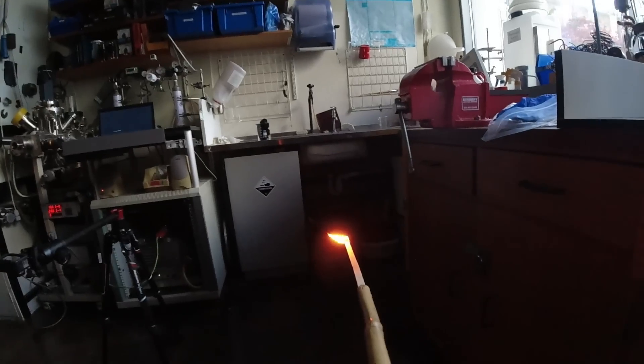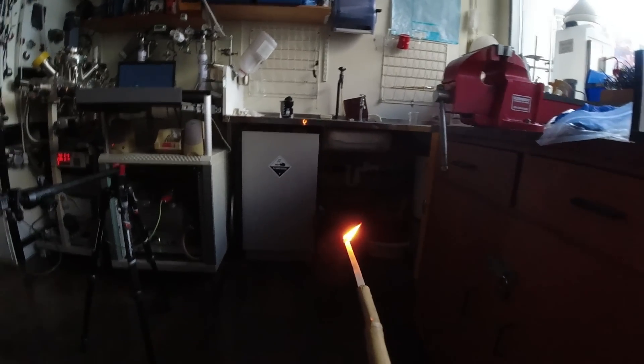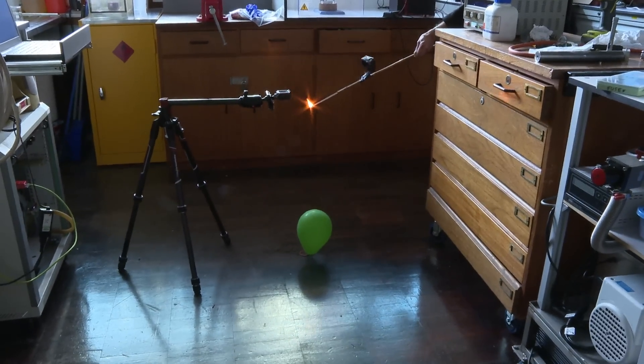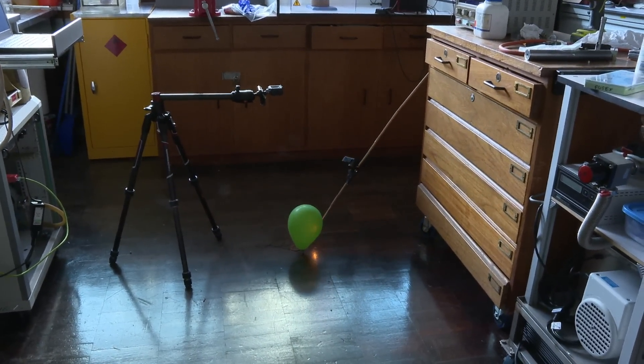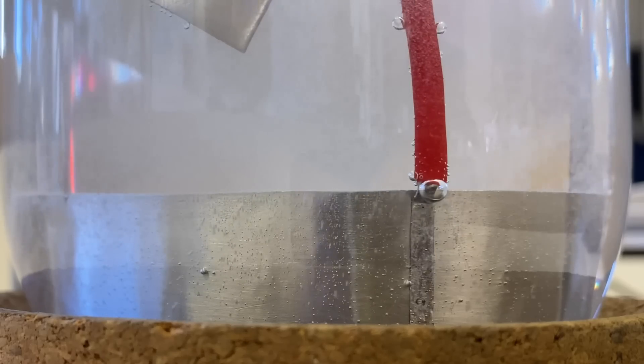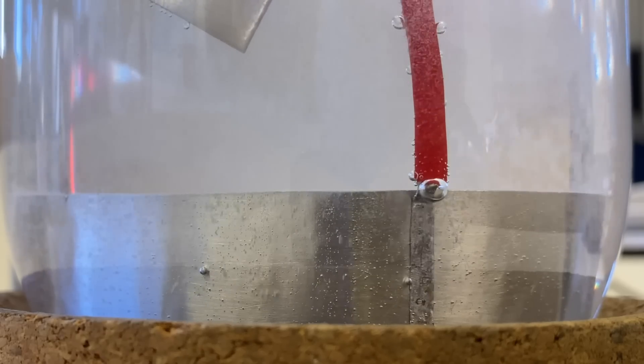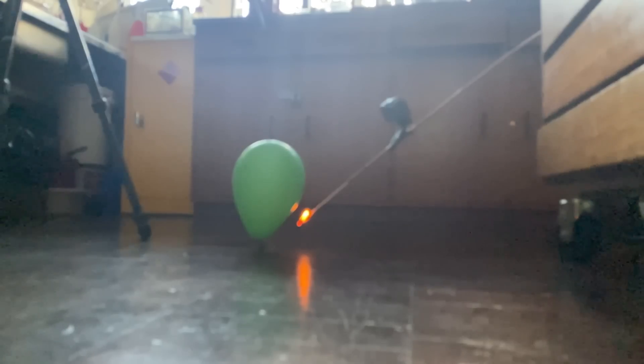And then with the match on the stick, it went with a big bang. And quite a loud bang because the hydrogen and the oxygen were not separated. So there was a hydrogen-oxygen mixture in just the right proportions. Two moles of hydrogen to one mole of oxygen so that you make water with a nice bang.